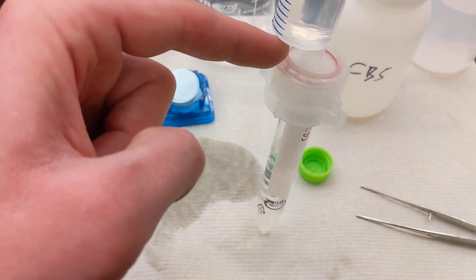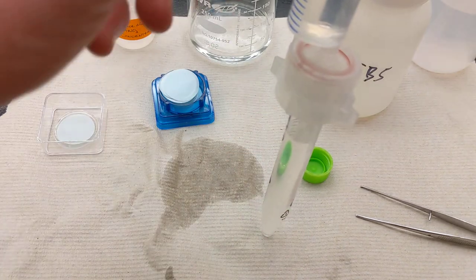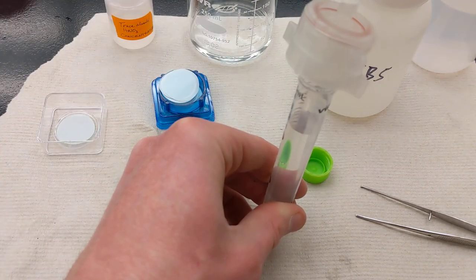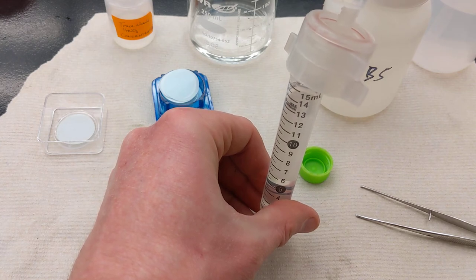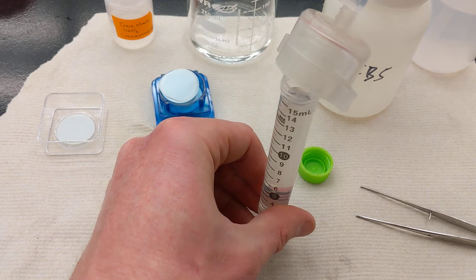So if you're leaking more than you're filtering, you probably want to restart this over. So I'll do this until I've completely filled this. It may take a little bit of force, depending on how dirty your sample is.